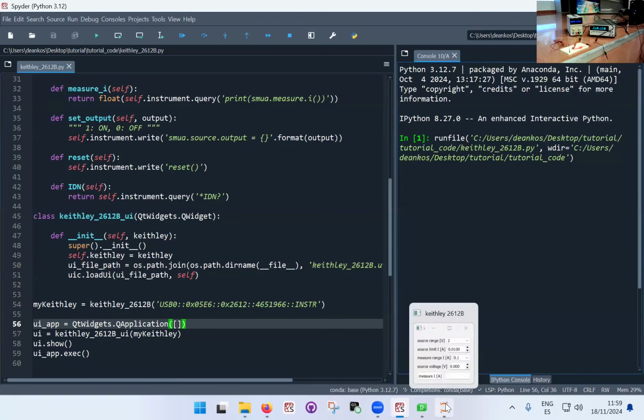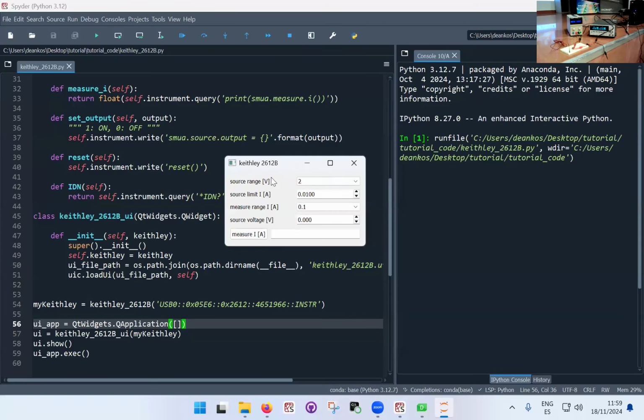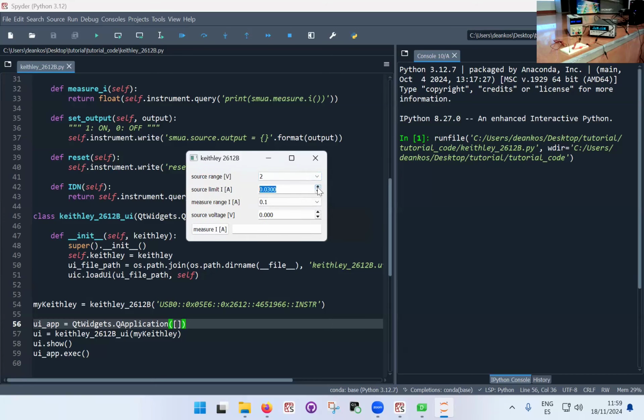There we go. This little thing popped up. This icon looks like the Jupyter icon if you're using Python for other things. This icon might look a little bit different, but in general, it should give you the interface that we just programmed earlier on. Now, of course, this interface is here. I can change things, but nothing happens because nothing is connected to anything. PyQt is showing me this. It's allowing me to change things, but I haven't programmed any interaction with the actual instruments. I can press these buttons, here I can write stuff, but this doesn't really mean anything. So what we need to do now is connect all these so-called widgets to functions inside the Python script.